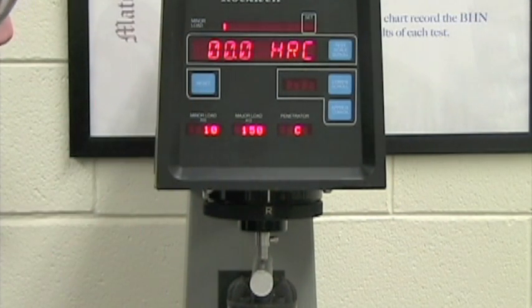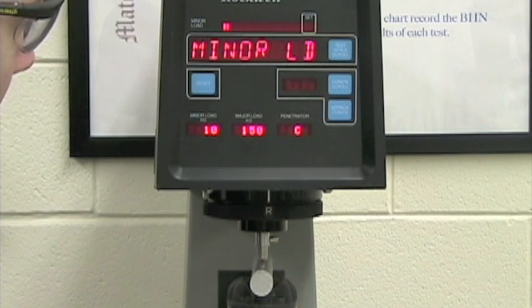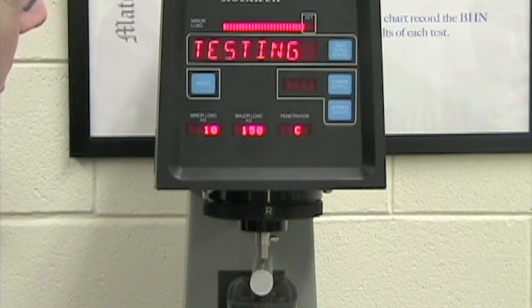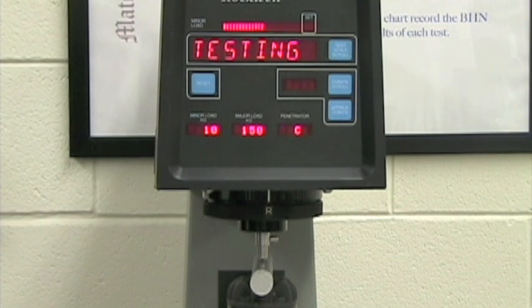And now you see the minor load right here is just, you see one little red bar. Now we're going to keep pulling it until it says set. It's going to be testing now. And that is our reading for this.